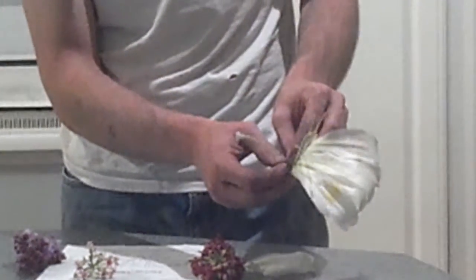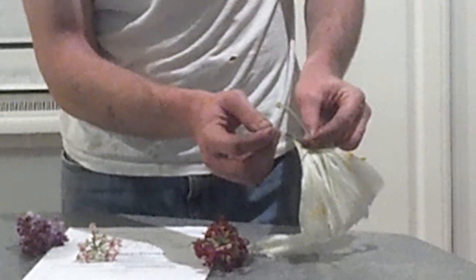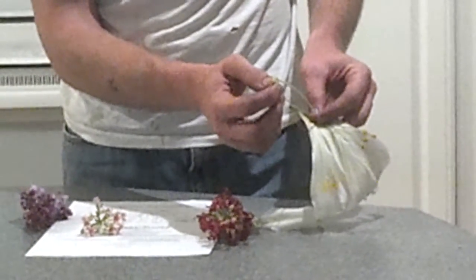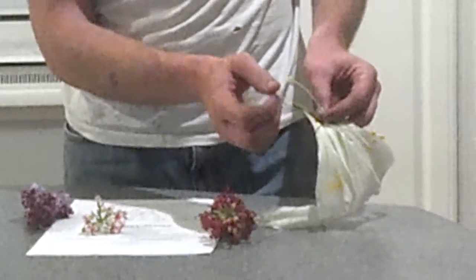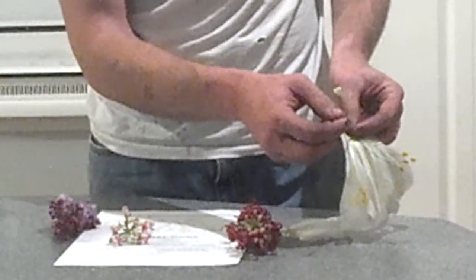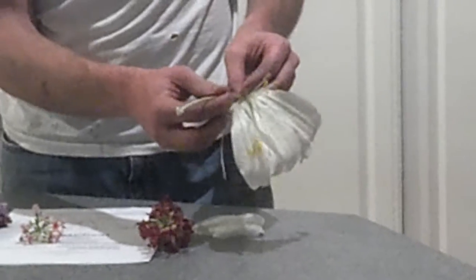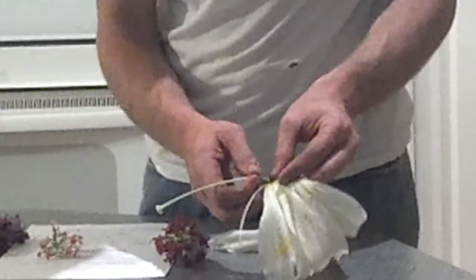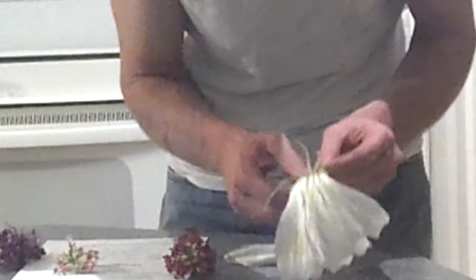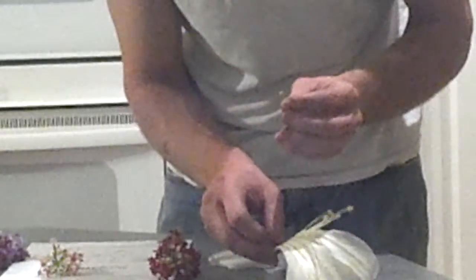the seed when fertilized by the pollination of the pollen coming from the anther over to the top of the pistil, which is going to be your stigma, and that's fertilizing right there. You have your style underneath the stigma. This is just the tube on the top of the ovary, which carries that pollen down from the stigma to the ovary here. And if I pull this apart, I doubt we'll be able to see much in there. Nope, just the tubes where the seed formation is going to occur.